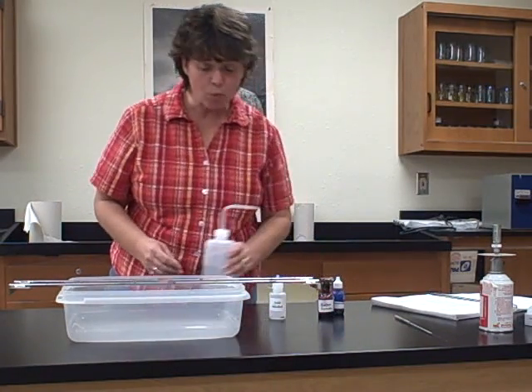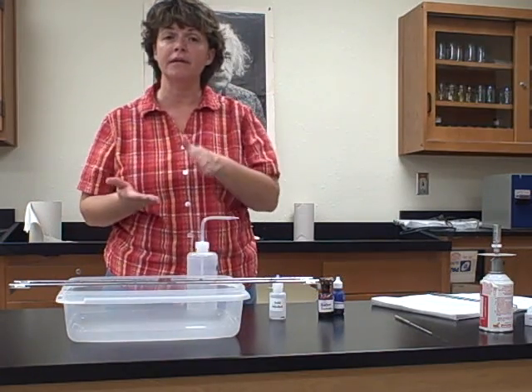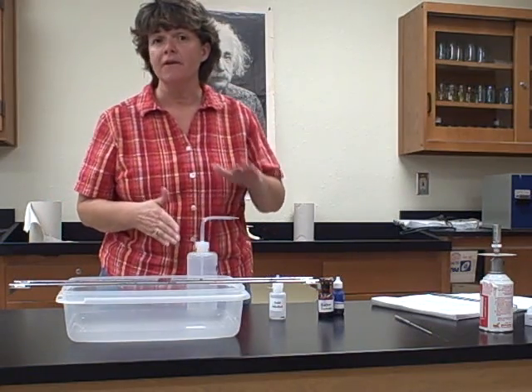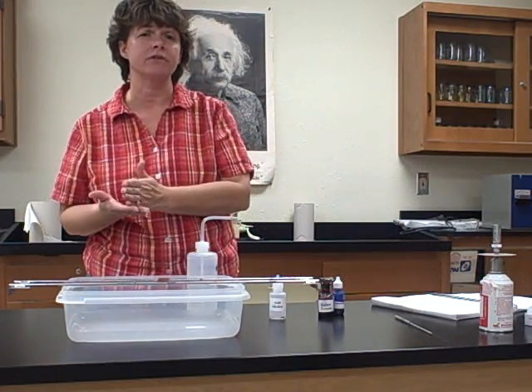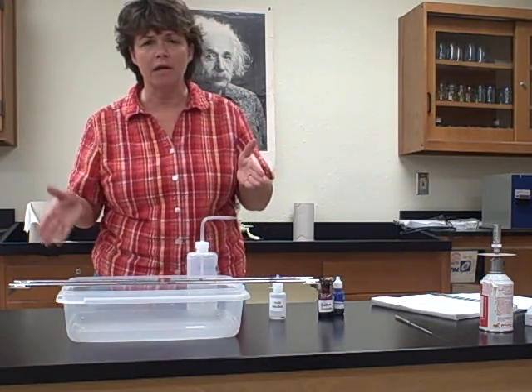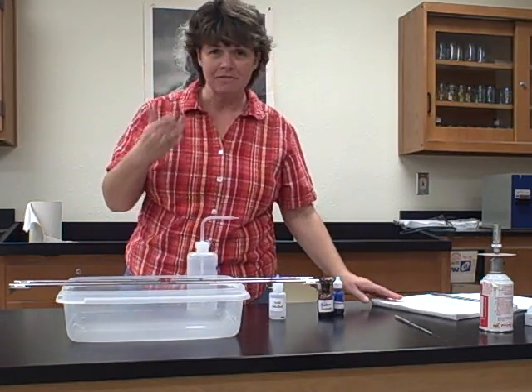Now, with the Gram stain, the positive cells were purple and negative cells were pink or red. At the end of the acid-fast stain, the acid-fast positive cells are going to be red, and the negative cells are going to be blue. So don't ever cross over between stains. Don't think that purple always means positive and red always means negative, because in this particular case, red actually means acid-fast positive.